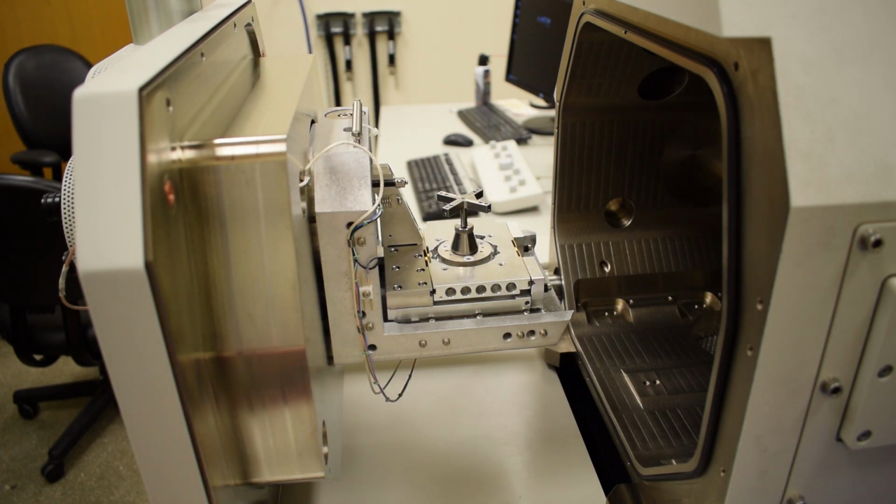So I'm going to go put on gloves. We always keep gloves by the microscopes, so you should be able to readily find new clean gloves. If for some reason one of the boxes has run out, contact one of the staff and we will find more. We want to always keep the systems clean.